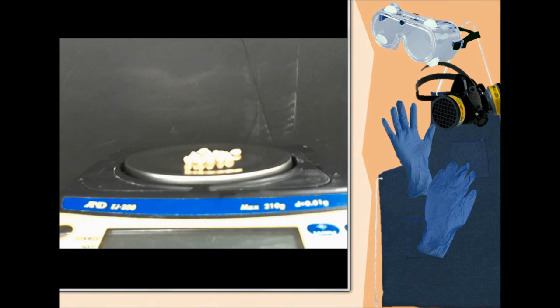Now that I've showed you in instruction form how to measure density by displacement, I am now going to show you how to measure density by displacement visually. Here I have 20 popcorn kernels, and I'm going to measure their density. Now keep in mind, the density of 20 popcorn kernels is the same as the density of one popcorn kernel, is the same as the density of 100 or 1000 popcorn kernels. Density doesn't change for the amount of the substance. As I have more of these, the mass will change, the volume will change, but the density of popcorn kernel is always the same number. I'm going to use about 20 of them because if I were to just use one, it would be really hard to figure out exactly what its volume is because it won't, by displacement, push the water up enough.